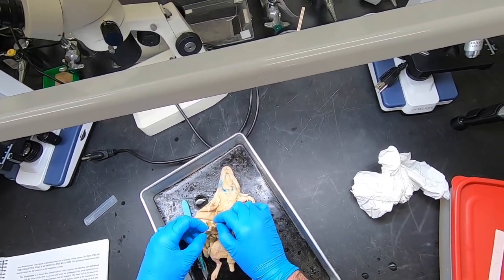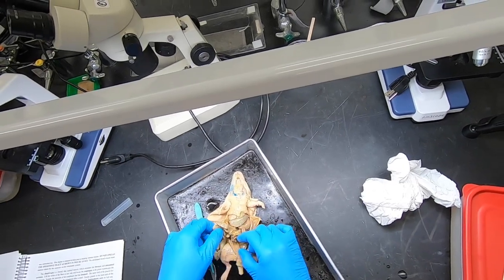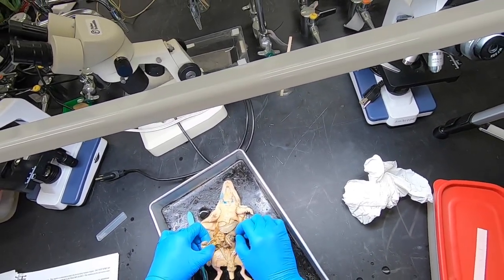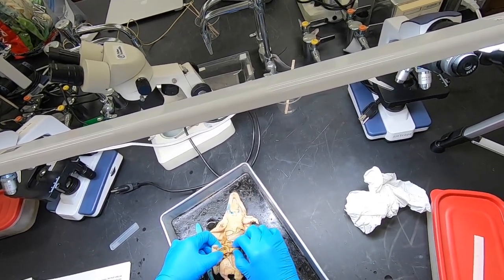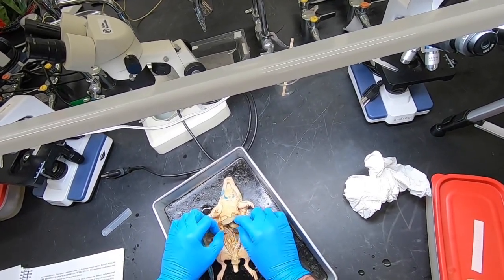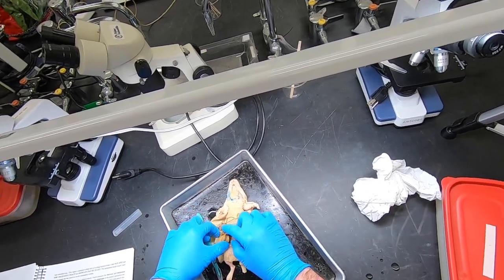That is where the small intestine meets the large intestine. You can feel around in there—I can feel the sphincter which is going to stop the movement past the cecum until the bolus of digested food is ready to move on to the large intestine.